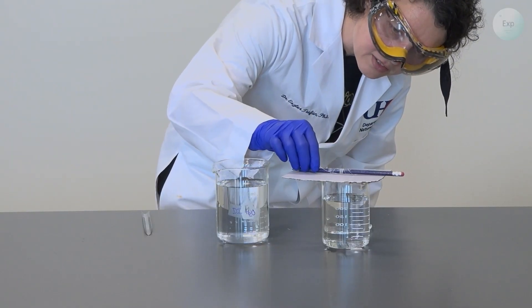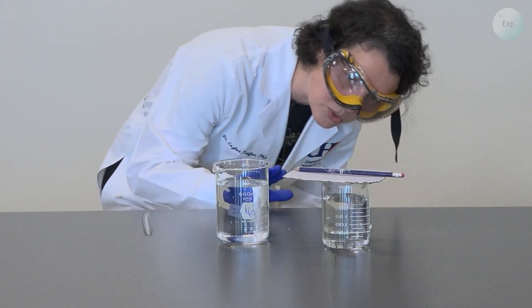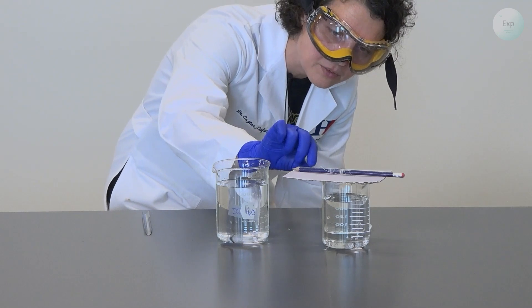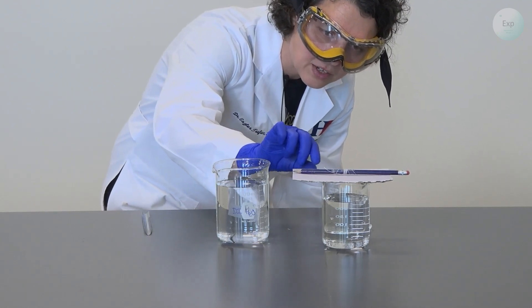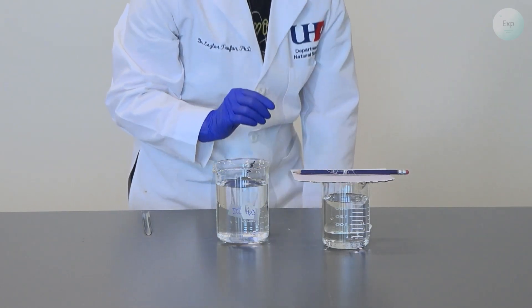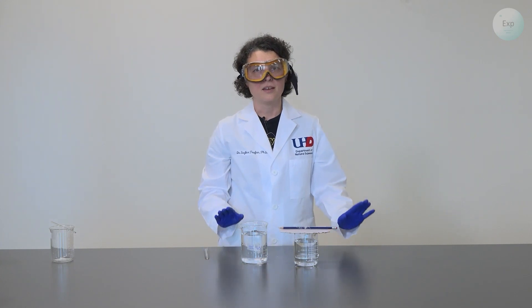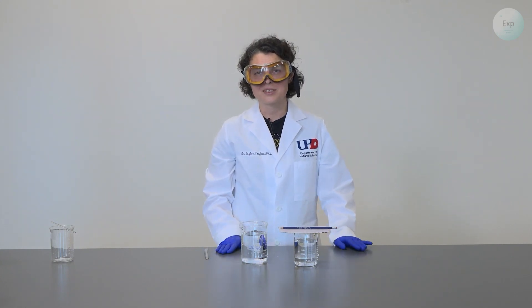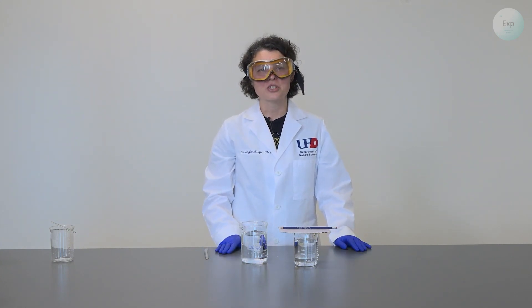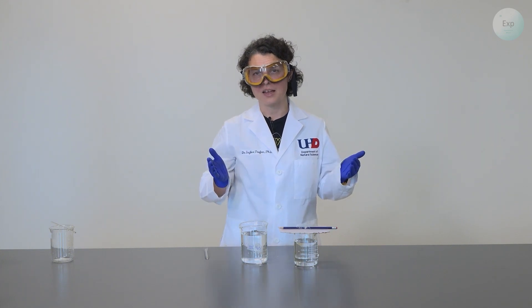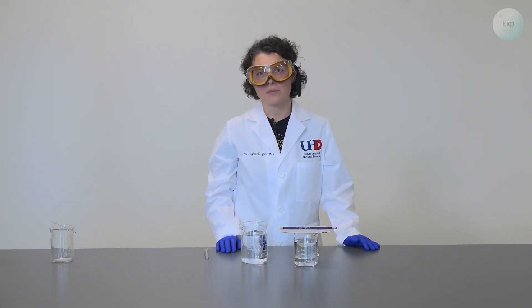If you need to, you can adjust the height of your crystals, making sure that they are approximately in the middle of your grow solution, and not touching the sides of the beaker or the bottom of the beaker. And for sure, they are not exposed to the air because then whichever part is connected to something else or exposed to air, that is the part that will not grow.